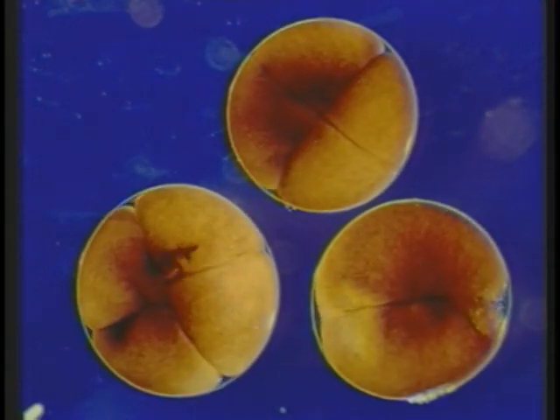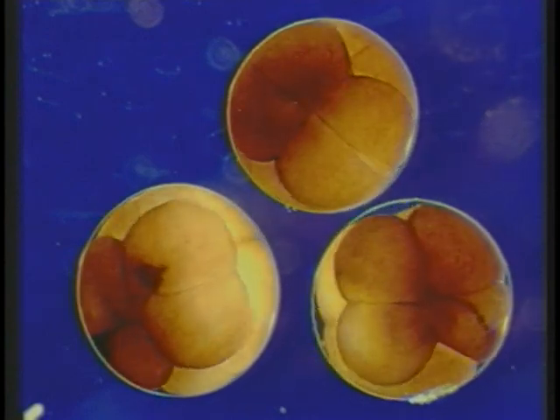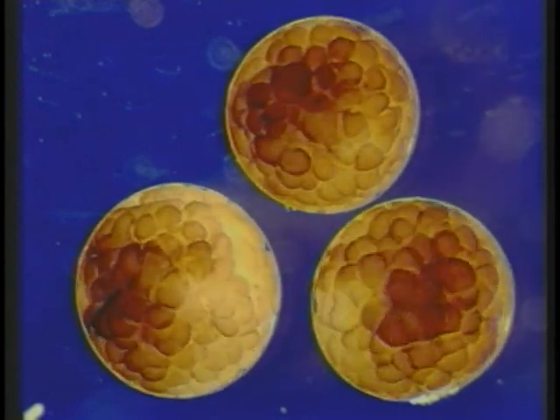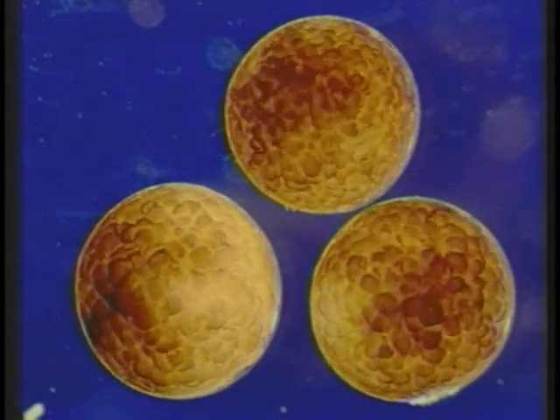This sequence shows embryonic development of three Xenopus tadpoles over 18 hours. Note that during the early cell divisions, the size of the embryo does not change.